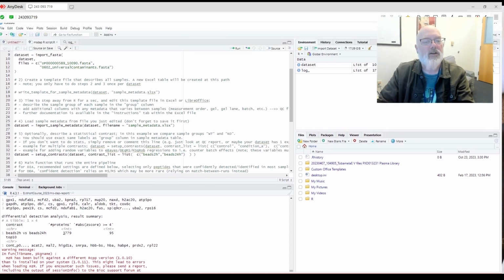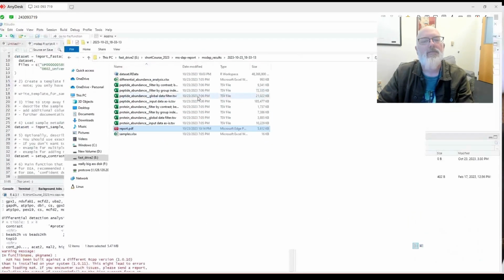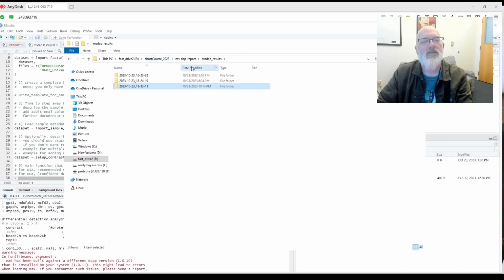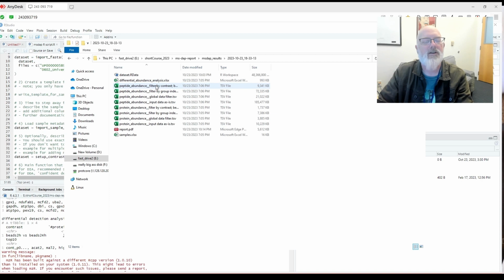All right, so it finished, and let's look at what MS-DAP spit out. I had the results go to this MS-DAP results directory, and you notice the results are timestamped, which is awesome.